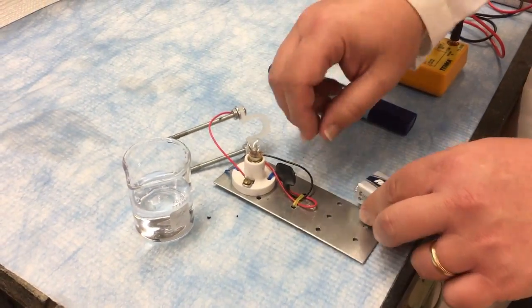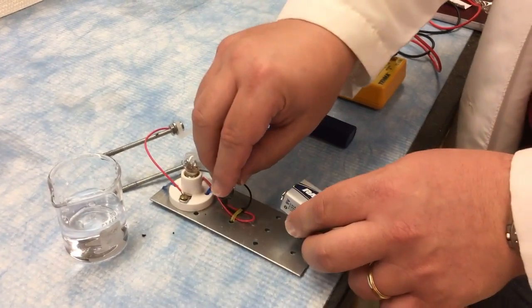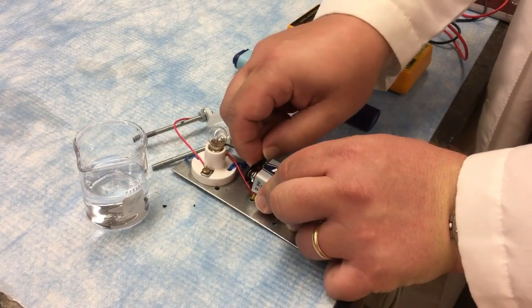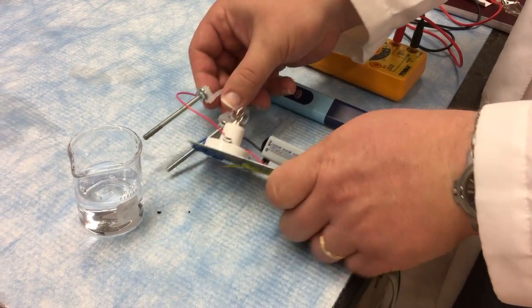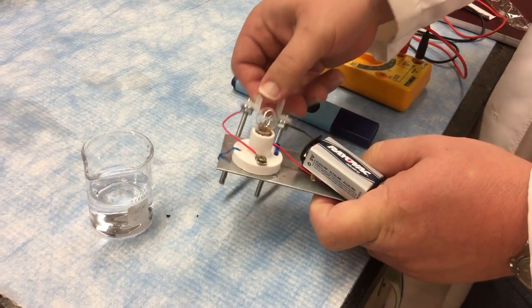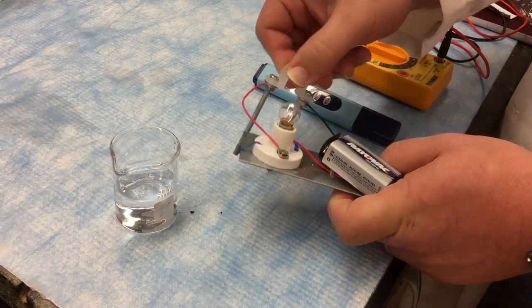The home-built one is incredibly simple and if it breaks you can fix everything with just a screwdriver. The main thing you got to do is it has no off switch so you just plug in the battery when you're ready to go and as you can see if the battery is plugged in and the leads, battery's got to be clipped in well and the leads come into conducting solution, the light goes on.